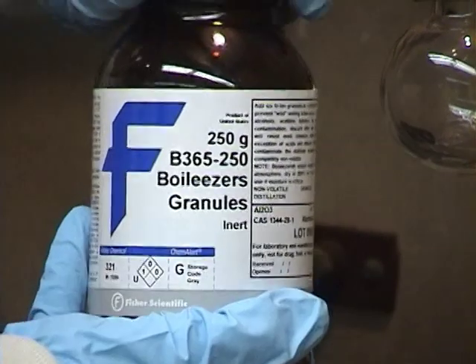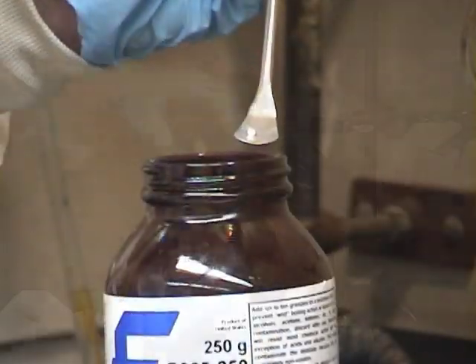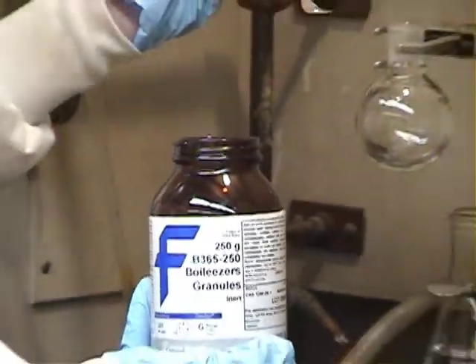A stir bar, or boiling stone, is added next. Here, you can see one single boiling stone.